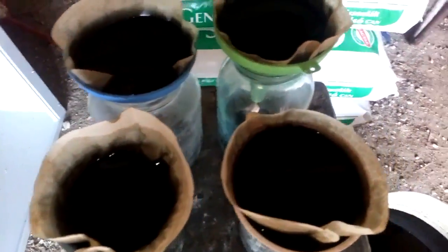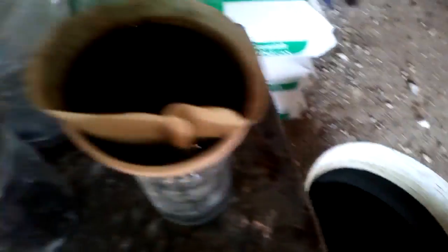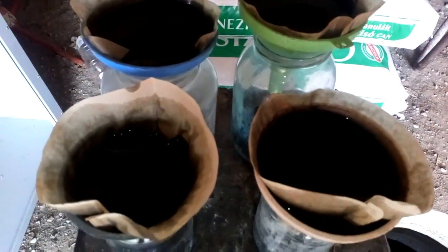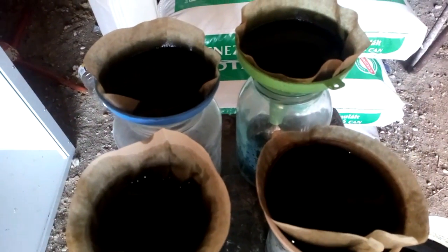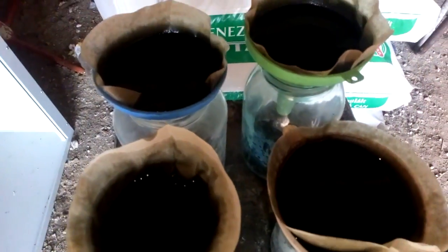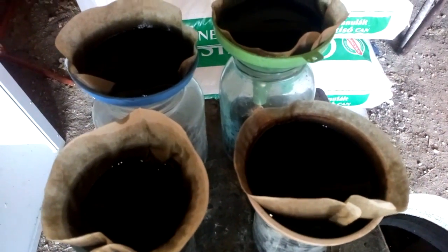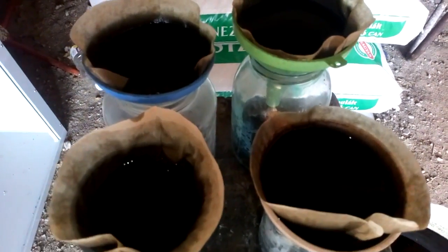Let's start the filter. I use a couple of coffee filters because it's a lot of solution. I wish I had that filter like Omar Iqbal but it's hard to find that filter for me, so I use normal filters — four of them. It will take most of one day to filter all this solution, so I will come back when I finish to show you the results.